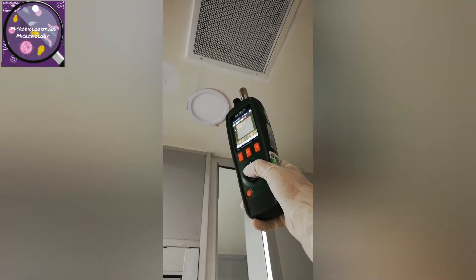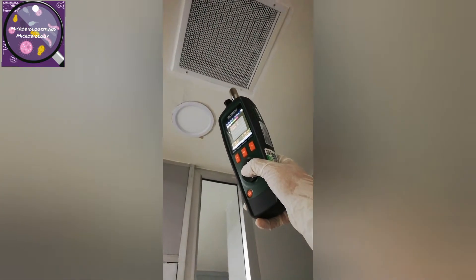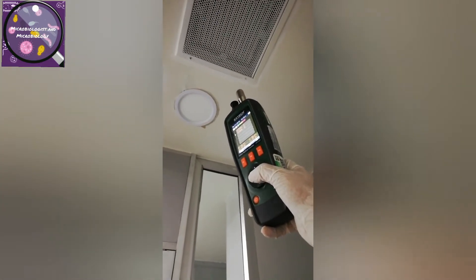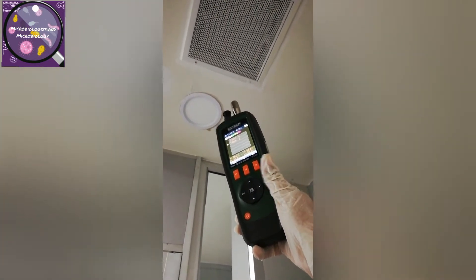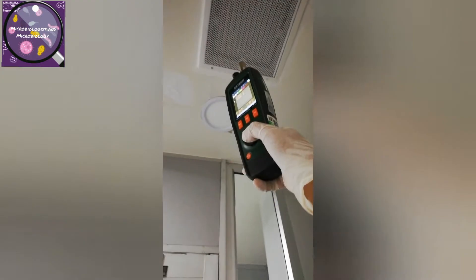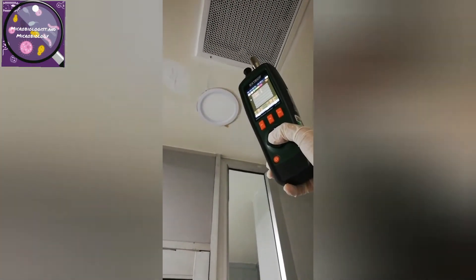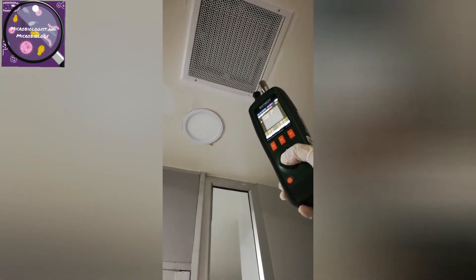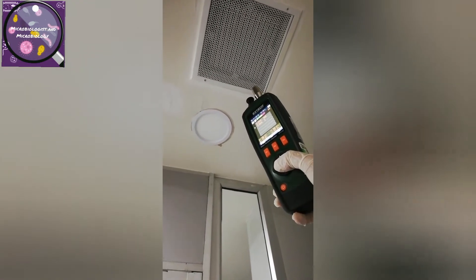Now I am near the HVAC filter that is giving fresh air right now. So let's check if the air is clean or not. I have started with the start button — you may hear the sound. The time I have selected is 60 seconds.